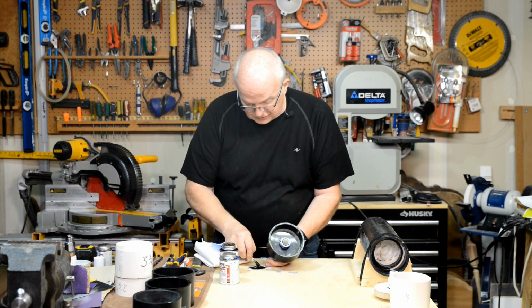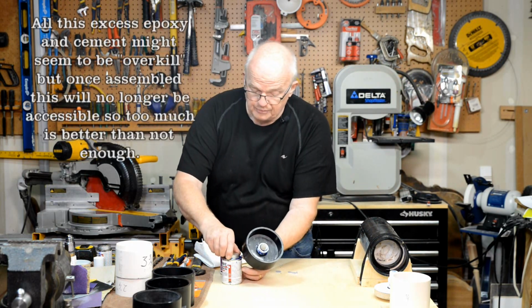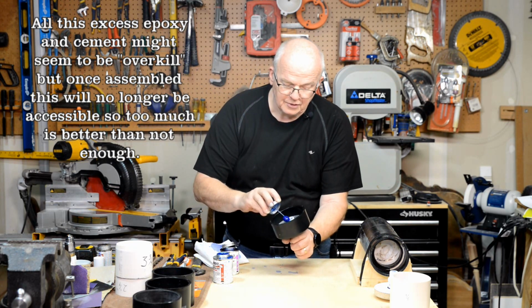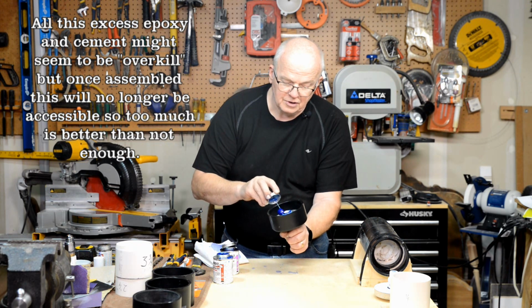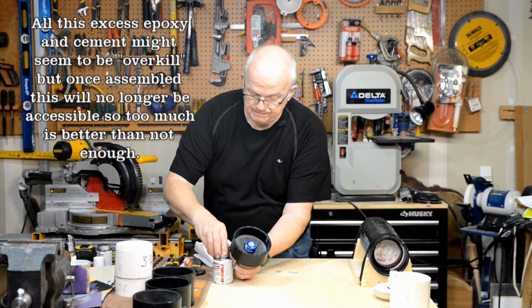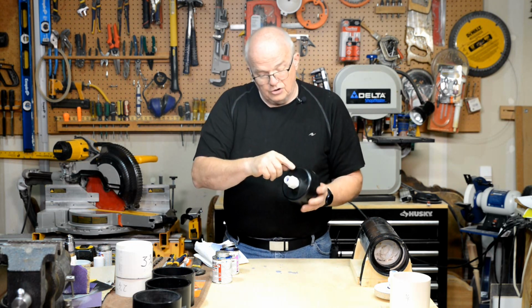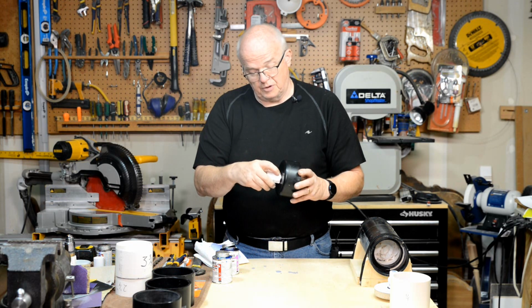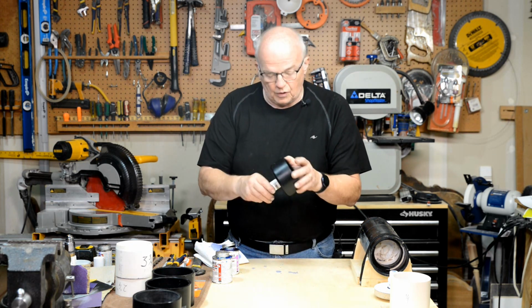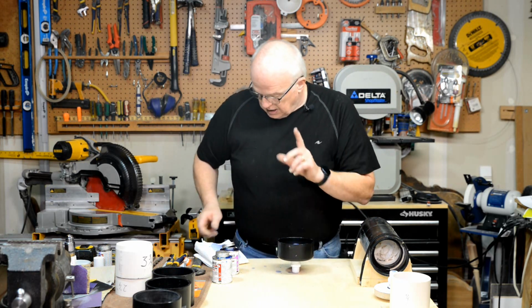Now, see, this is already beginning to set up, so there's nothing left of that. But you can go ahead and use cement, if you want, around that top edge. Okay, I'm going to put some cement all around that top edge, just as an added seal to the whole thing. Okay, and there you have it. This thing is in there. It's not going anyplace. It's already solid. Again, don't wipe any of the goop off or the epoxy off around this edge. That edge is just fine. And you can see, just make sure that it has squeeze out all the way around it on both ends, and it does. So we'll set that here and move on to the next part.